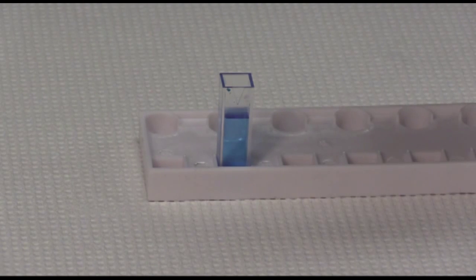This arrow means that when you put it in the spectrophotometer, you can always orient them so that they'll be facing the same direction every time.